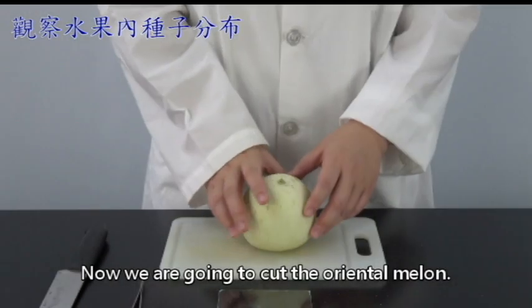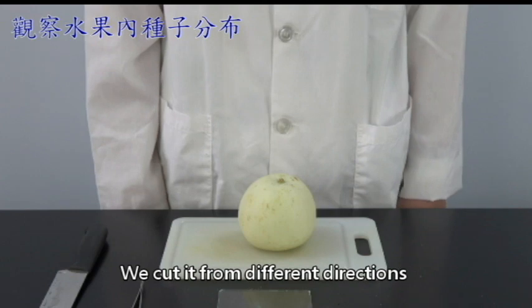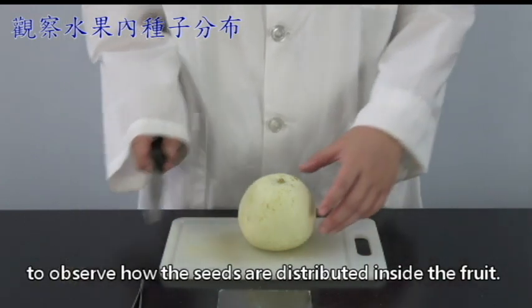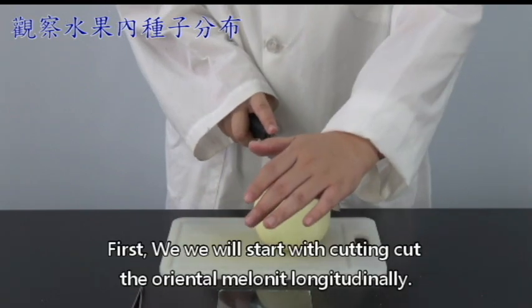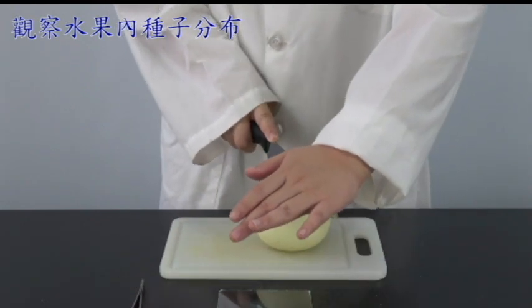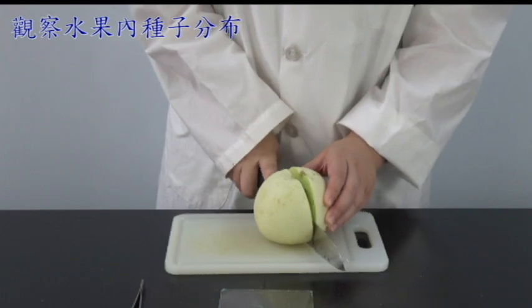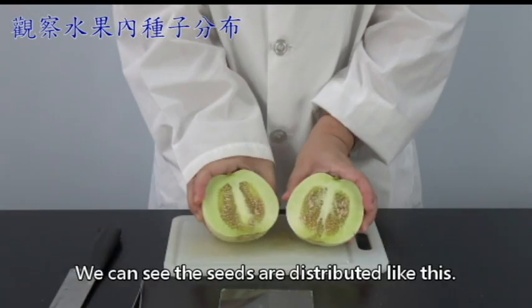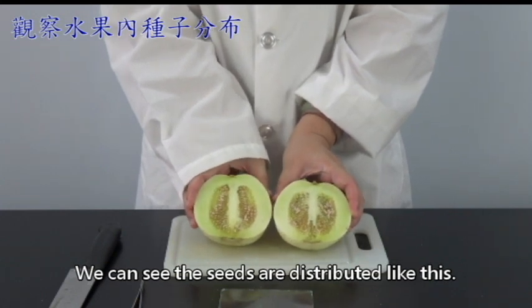Now we're going to cut the Oriental melon. We cut it from different directions to observe how the seeds are distributed inside the fruit. First, we will start by cutting the Oriental melon longitudinally. We can see the seeds are distributed like this.